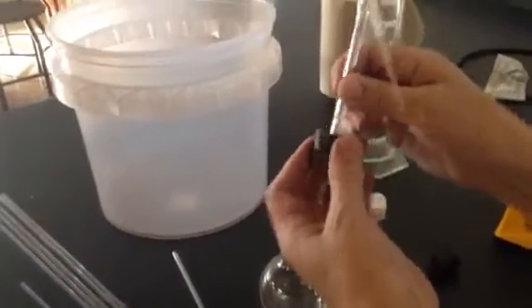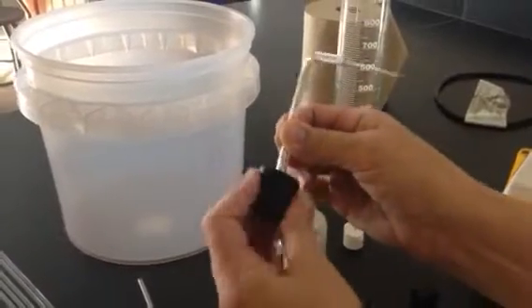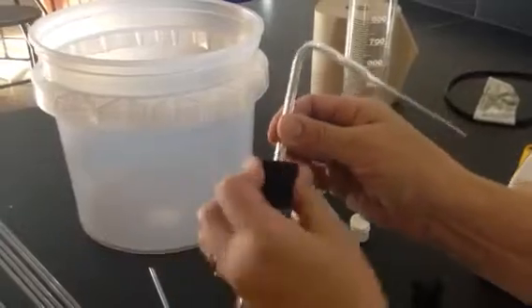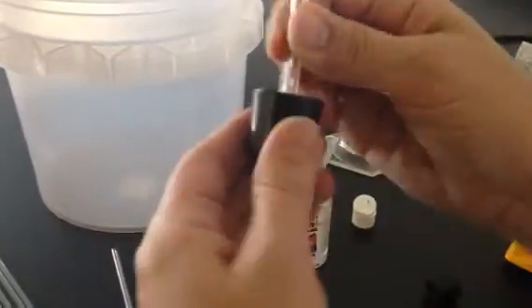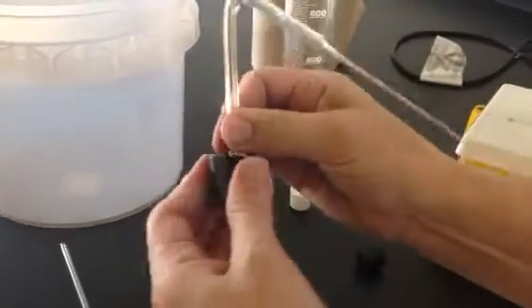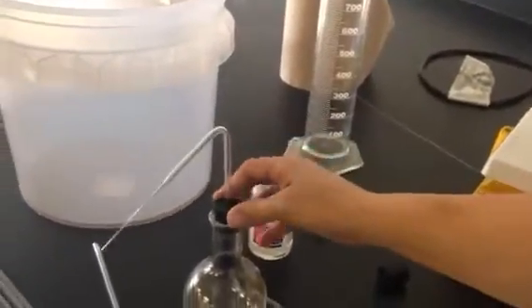And then I'm going to push that by pushing and rotating down into the stopper till the flat end that you fire polished shows up just level with the bottom of the stopper. Level with the bottom of the stopper. It's not there yet, so I keep going. You want it in there pretty solidly, and you want to be able to count on it sealing off that stopper. Once I have it, we'll have an apparatus that looks like this.